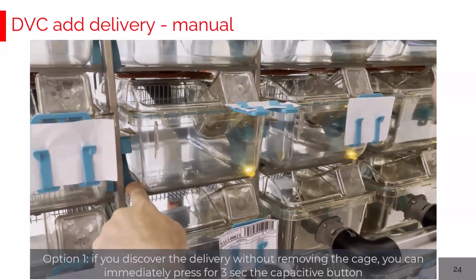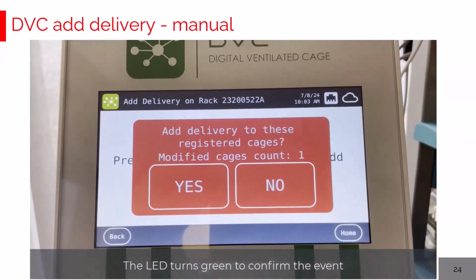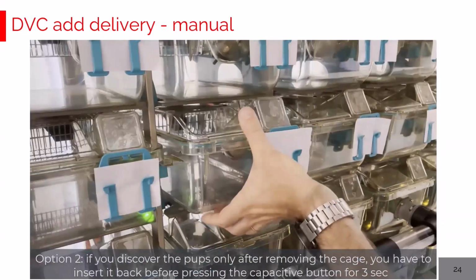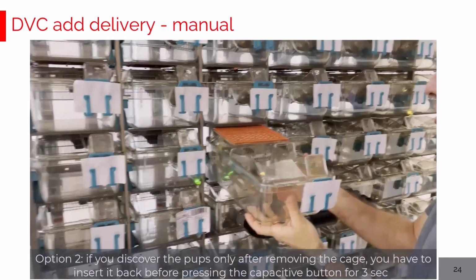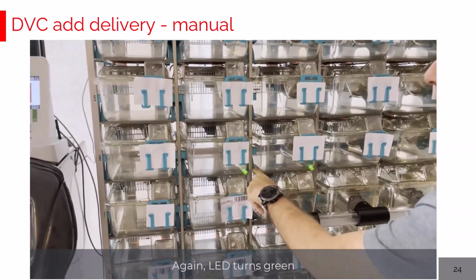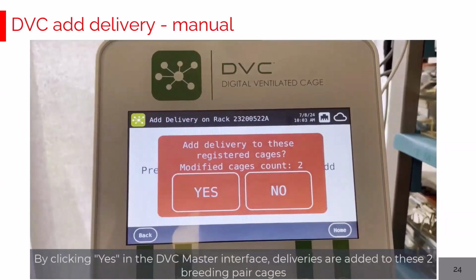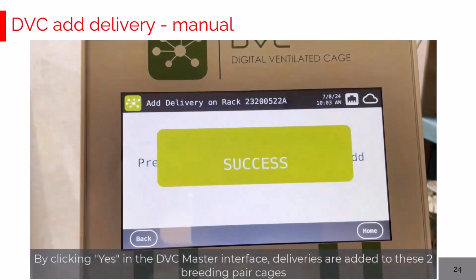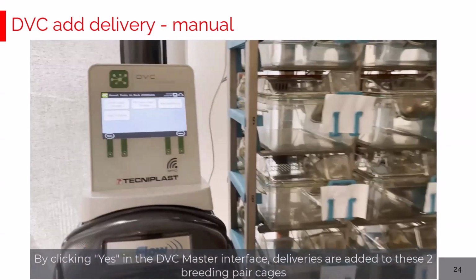You can keep the button pressed without removing the cage, simply because you were able to see the pups through the plastic of the cage, and the system confirms that there is already one cage with added delivery. Or you can remove it, check carefully, insert it back, and keep it pressed for 3 seconds as well. This will add a delivery to this second cage. If you are fine and you don't have any other pups in the other cages, you simply click confirm, and this automatically creates the corresponding delivery in these two breeding pair cages.